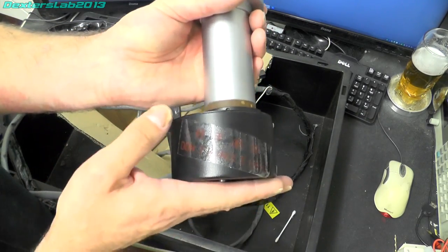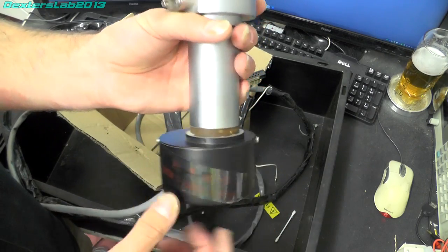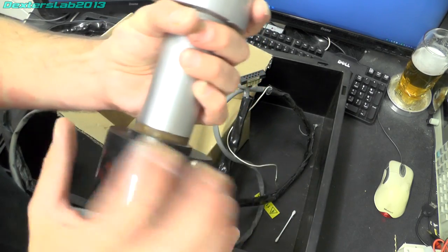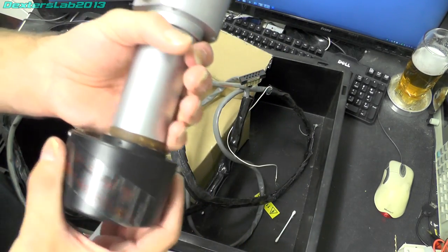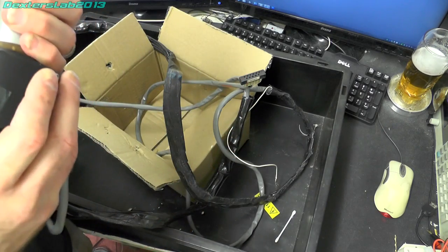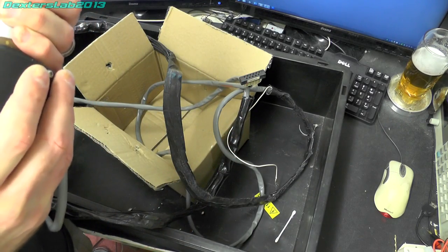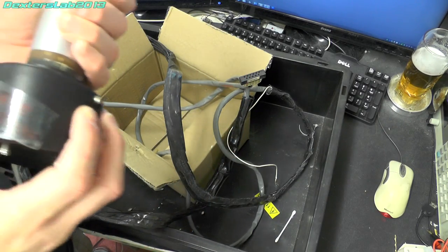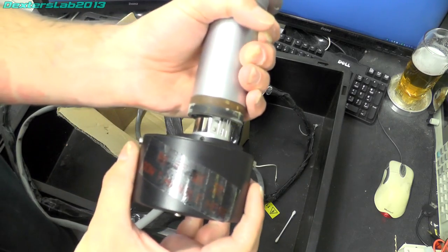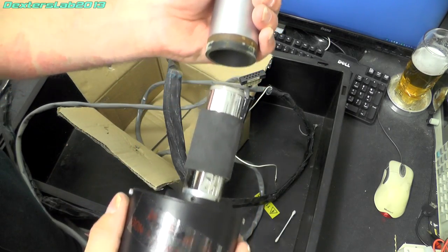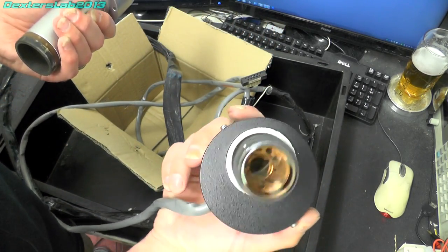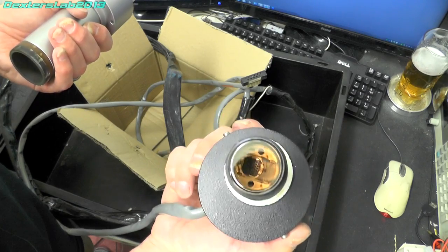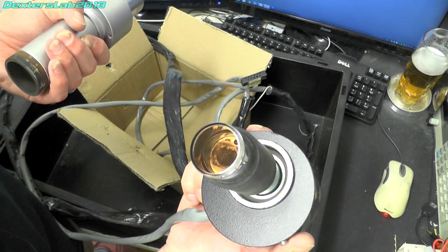Now the back here does actually remove off. There's three grub screws that I've removed out. And you can just separate the two. I'll just do that now. I'll just pull this apart and we can see inside there we've got a small front window photomultiplier tube.